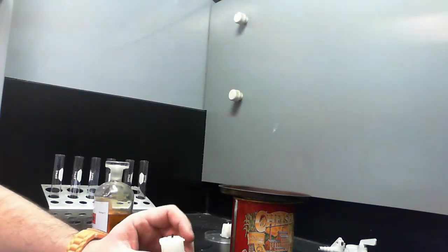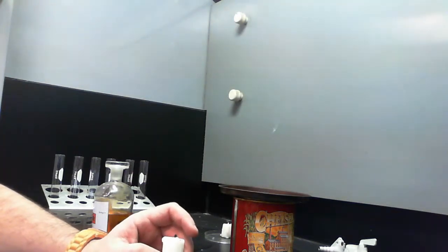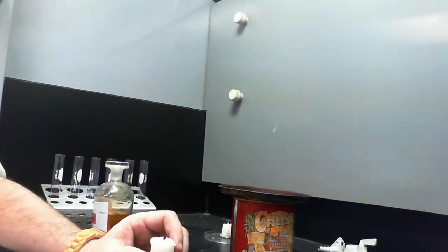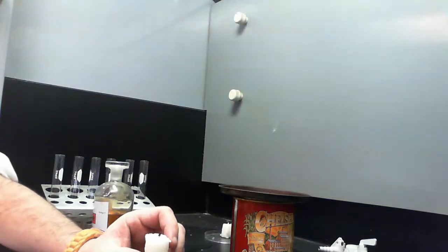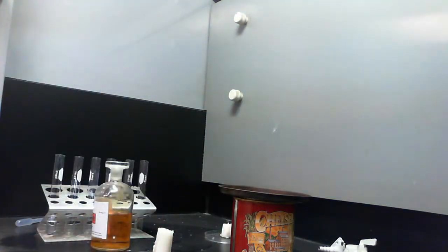So the wick is required to actually heat it up enough to break enough of those bonds to turn the wax into a gas around the wick, so that can burn. And the heat from that will cause more melting, which then allows more evaporation, so it allows the candle to keep burning. Another one we're going to use is a liquid called cyclohexane, and cyclohexane is really useful for us.